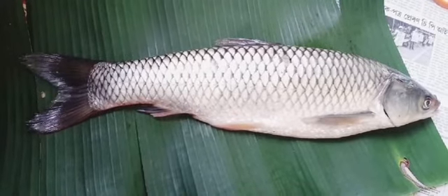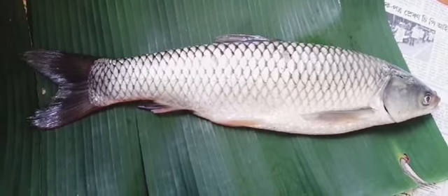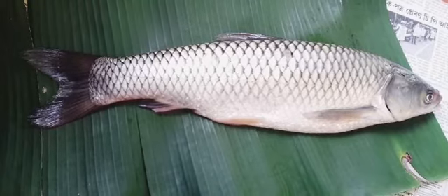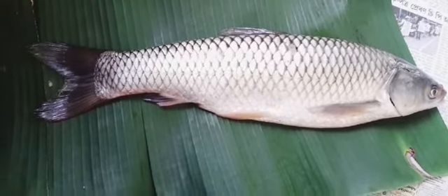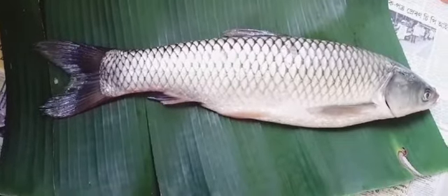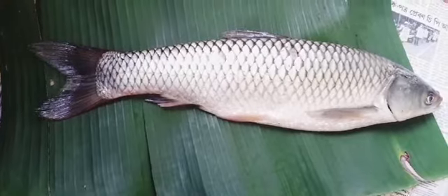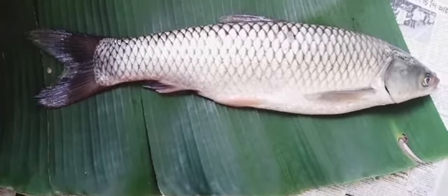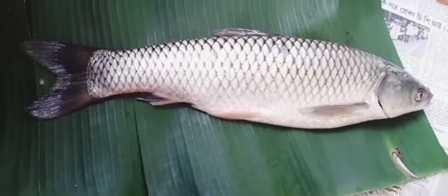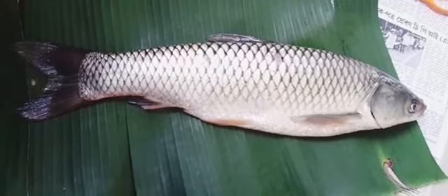There is the presence of pelvic fins, in both males and females. There is also another organ known as the air bladder, which helps the fish float in the water, preventing it from sinking. The mouth is terminal and they are cold-blooded animals. There is a two-chambered heart, and generally a single circulation.